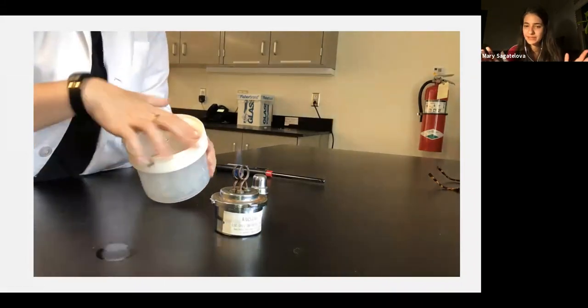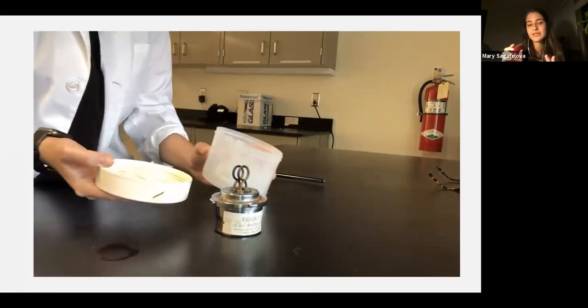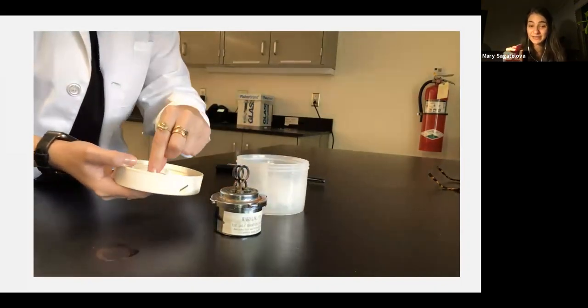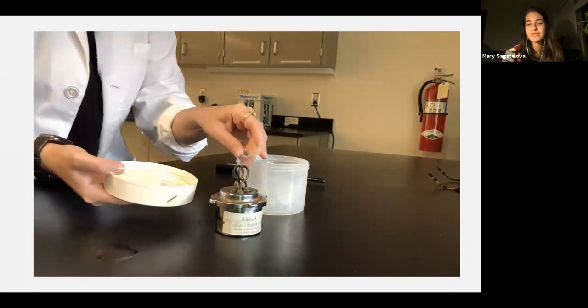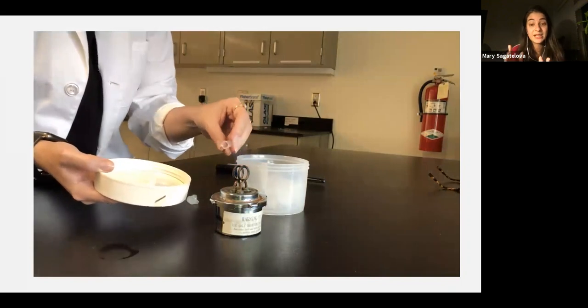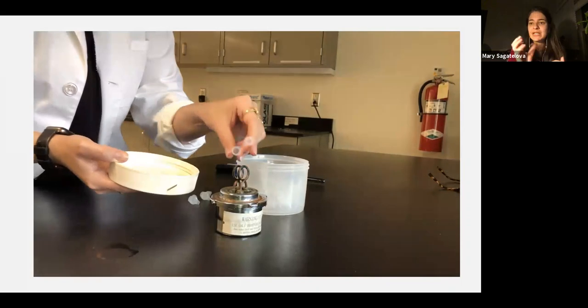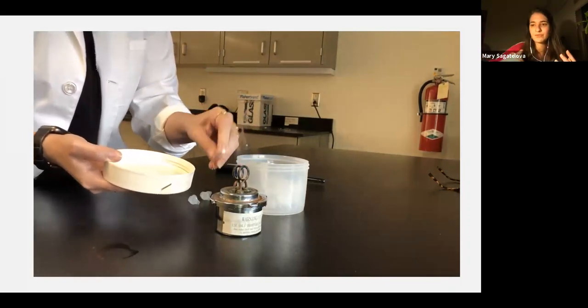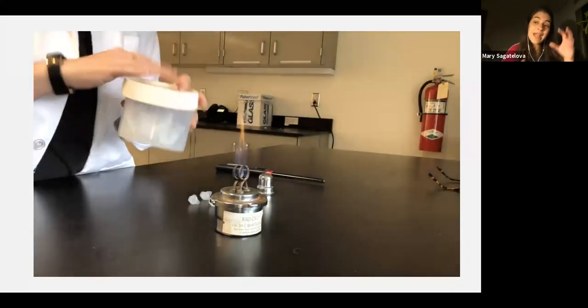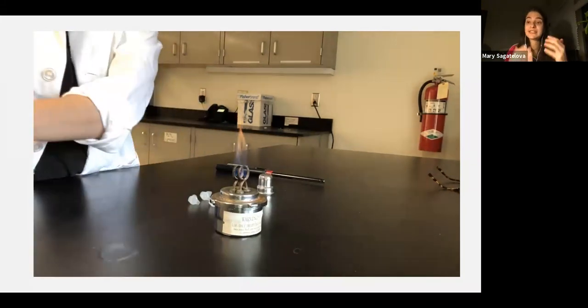So you're working within the aseptic zone. You're going to pour some of those microcentrifuge tubes onto the lid. Okay. You're going to close those tubes in the aseptic zone. So it's not directly in the fire because they are plastic, but you're going to close them in that heat so any microorganisms can be raised by the rising heat. Okay. You're never putting your germ-infested hands into that microcentrifuge tube container, which is sterile, because otherwise you will contaminate it for everyone. Okay. So don't be doing that.